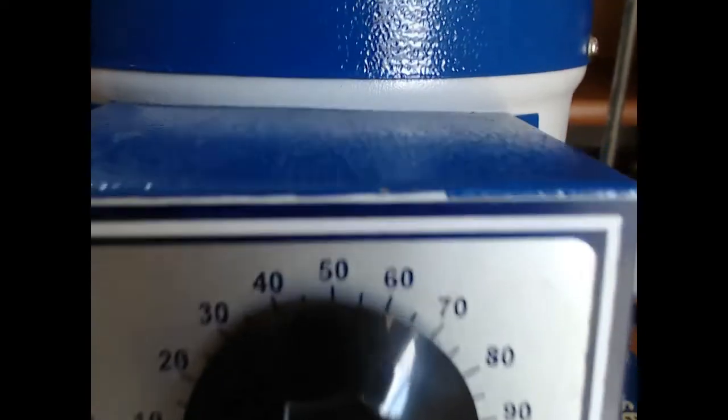Finally, everything is assembled. The heating mantle will be turned on and the contents in the round bottom flask will be brought to a boil.